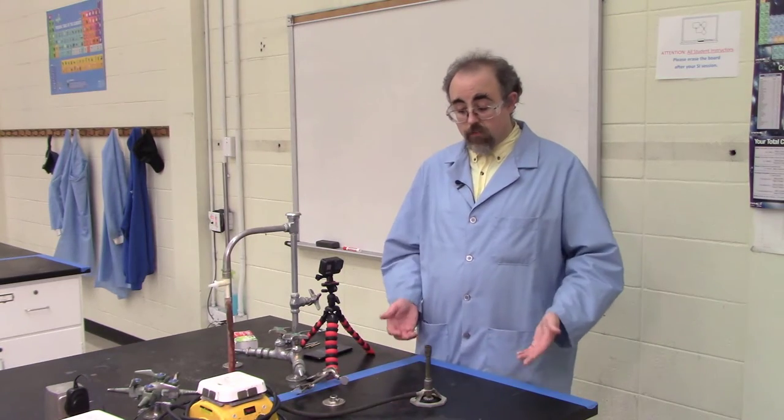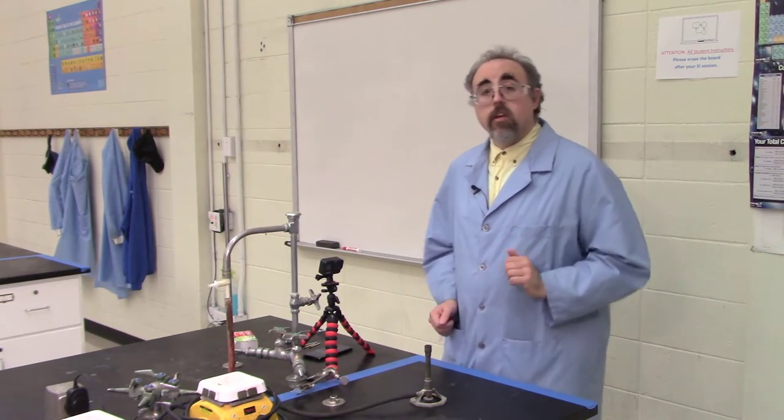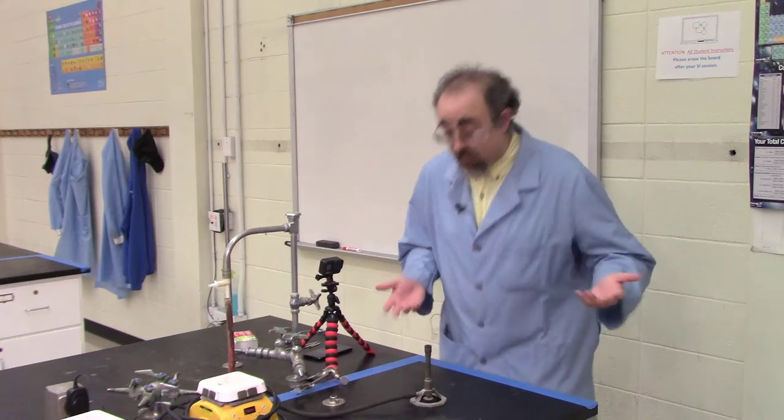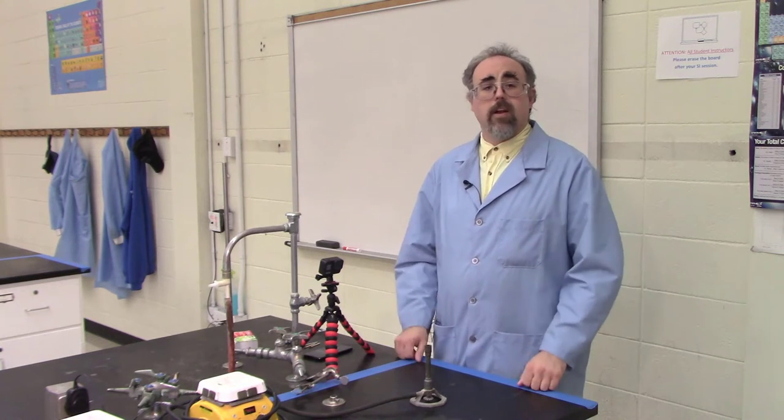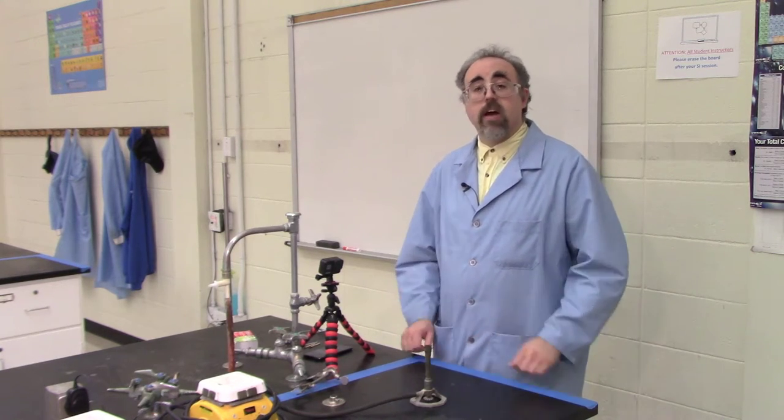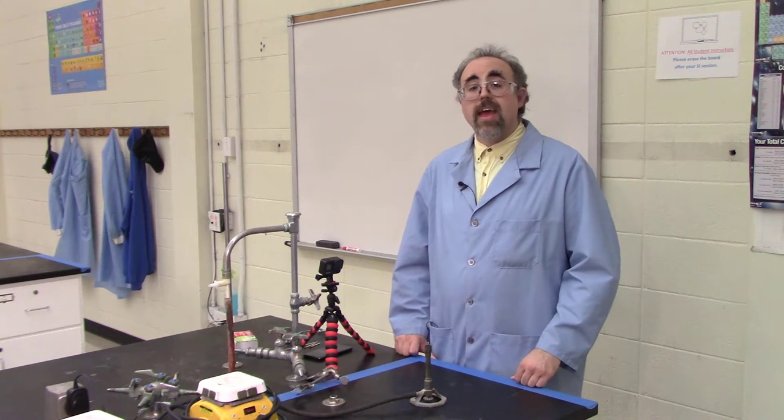Of course, it's still a big flame, so I don't want to just put my face over it. That would be ill-advised. You'll also notice that I happen to be wearing my cotton lab coat and cotton shirt today, where I normally wear nylon. That's because I'm working with fire. Cotton will burn, but it doesn't tend to melt, so typically when you are working with Bunsen burners, it is recommended you wear natural fibers and be quite familiar with how to put yourself out.